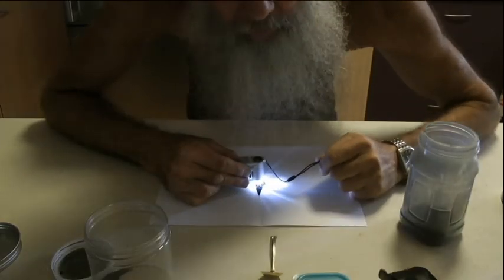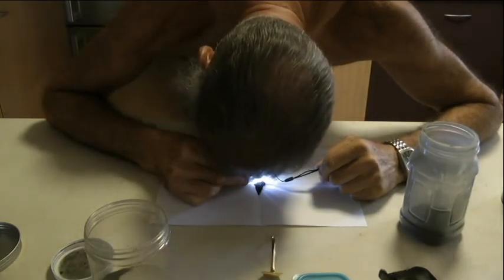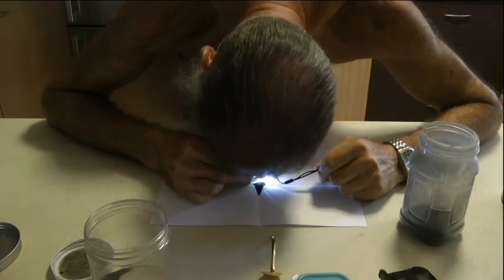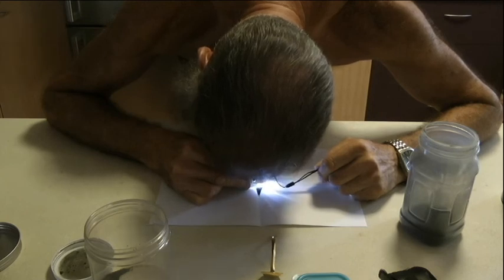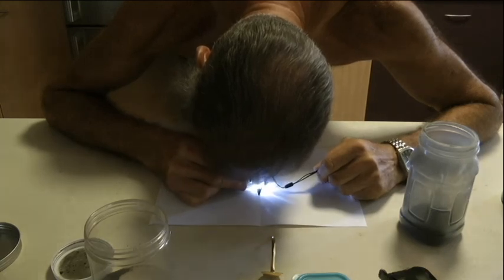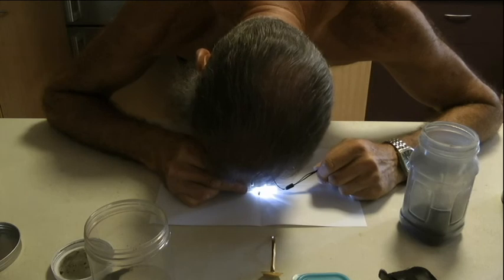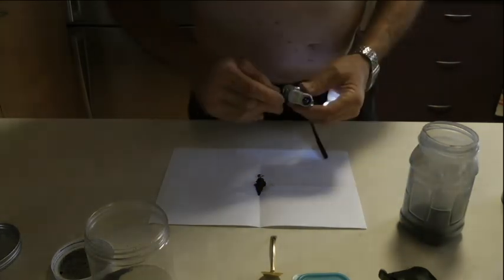I can actually see gold on the resin. Pieces of gold. This one's one I burnt up pretty badly. It looks like I've really cremated these ones. It's all sort of fused together, but I can actually see gold on it. Bits and pieces of gold. Whether there's a lot or not, or enough to make a difference, but it's there. It's actually there.